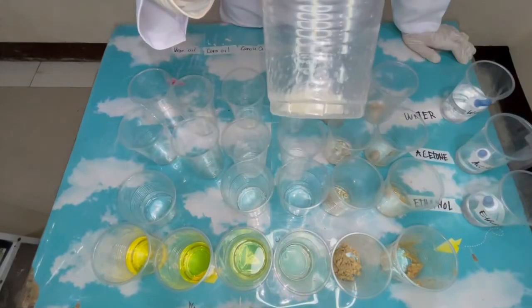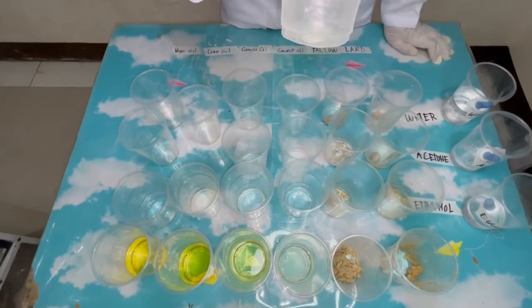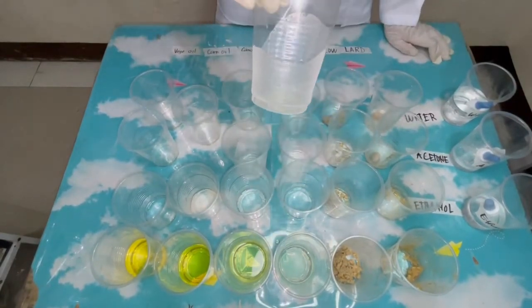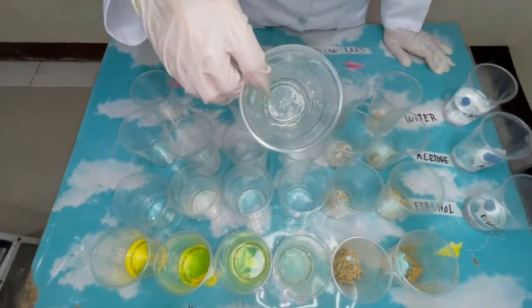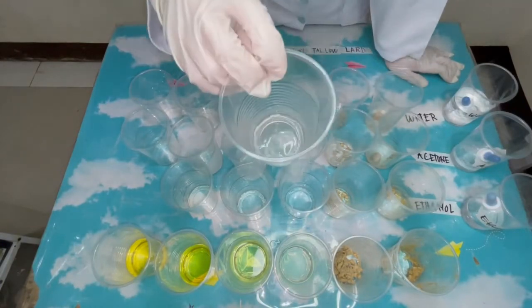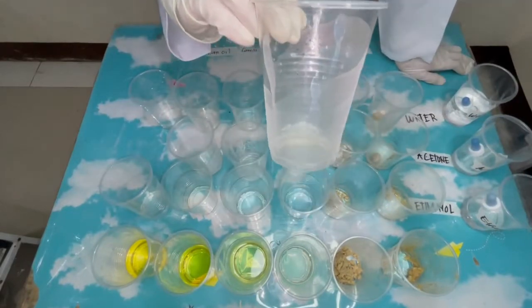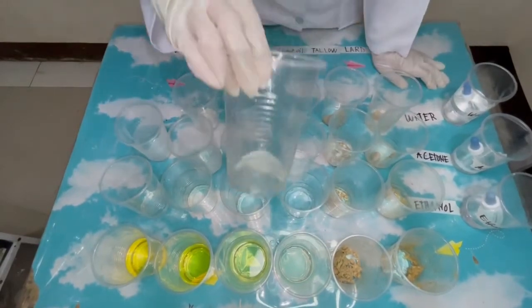For corn oil solubility: corn oil and ethanol is slightly soluble; corn oil and acetone is soluble; and corn oil and water is insoluble. Now for vegetable oil: vegetable oil and ethanol is soluble; vegetable oil and acetone is also soluble. And obviously, since vegetable oil is a non-polar solvent while water is a polar solvent, they are insoluble with each other.